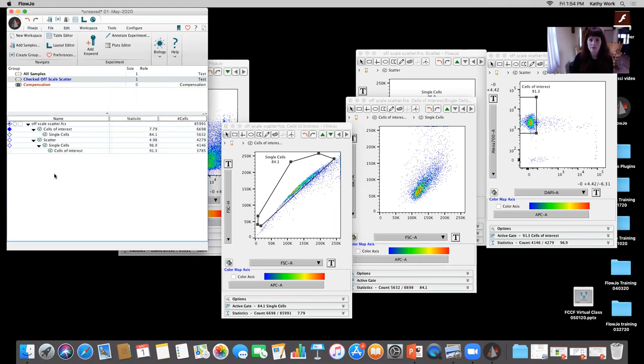Right? What does it really matter? The reason why this is so important, how you gate and what you're looking at, and you have to be very mindful of how you set your voltages and how you set your population gates, is because the user that was sorting their cells went through and did it based on scatter, single cell, cells of interest. And if you look here, the number of cells that come out of the same file is 3785.